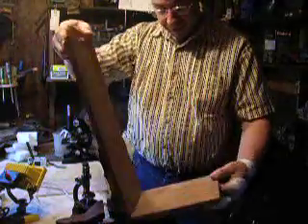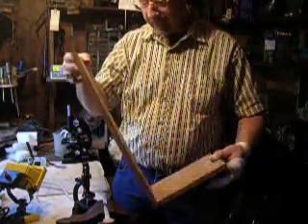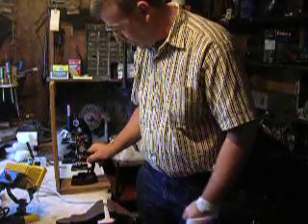You make an L-shaped piece of wood. I just attach two pieces of plywood together, three screws in the back. Then you can have that as the stand.